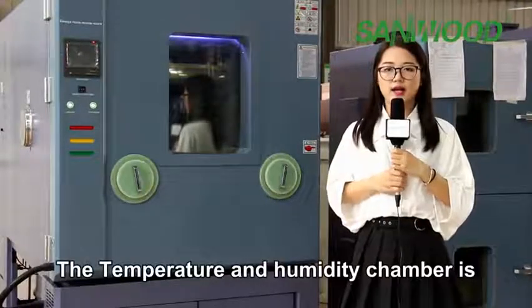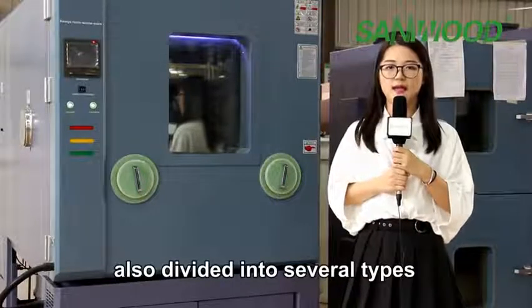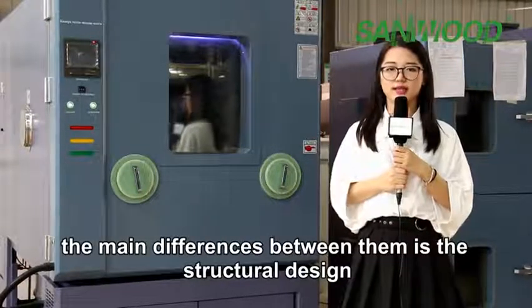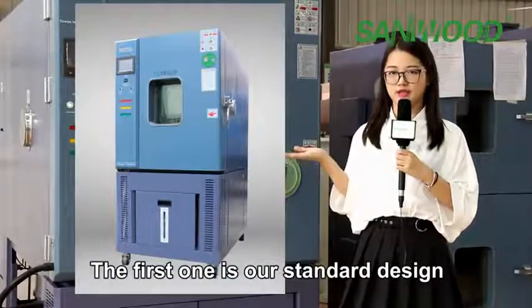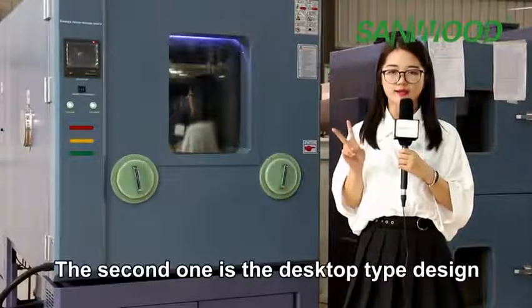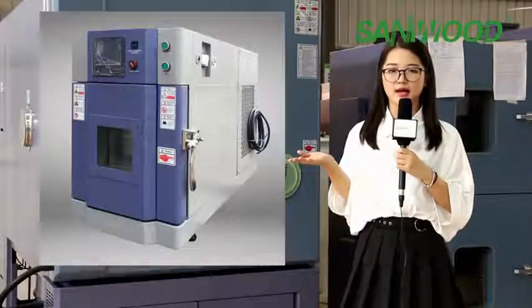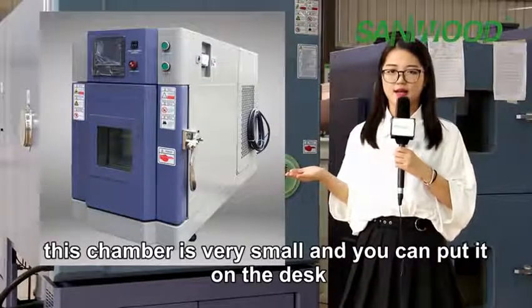The temperature and humidity chambers are also divided into several types. The main difference between them is the structure design. The first one is our standard design, which is the most common. The second one is the desktop design. This chamber is very small, you can put it on your desk.